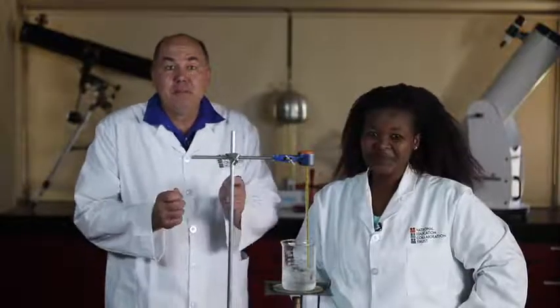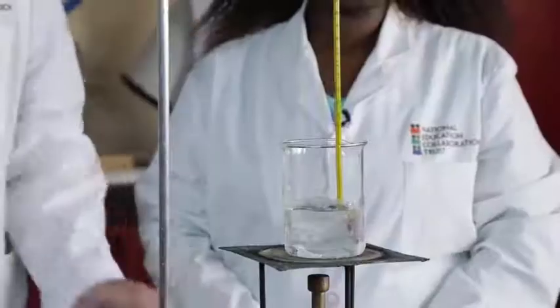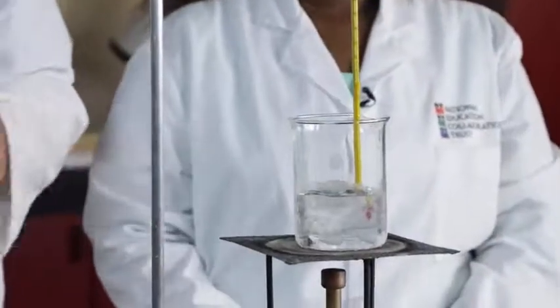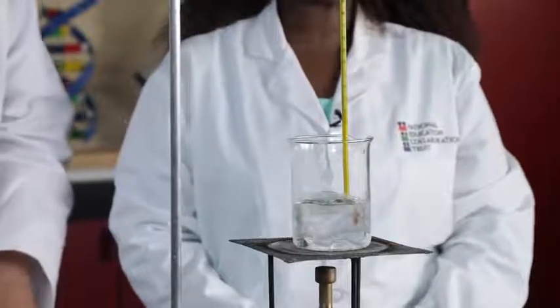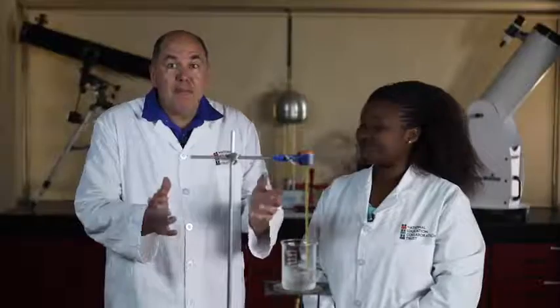Yes, the Bunsen burner flame must be adjusted to burn at a constant rate. We must set the Bunsen burner to burn and to leave it at that setting for the entire investigation. We mustn't readjust the Bunsen burner flame at any stage during the investigation. The rate of heating is controlled. The mass of water must remain constant. We start off with a certain amount of ice in the beaker, and we shouldn't add or lose any of the water during the investigation. That makes sense.